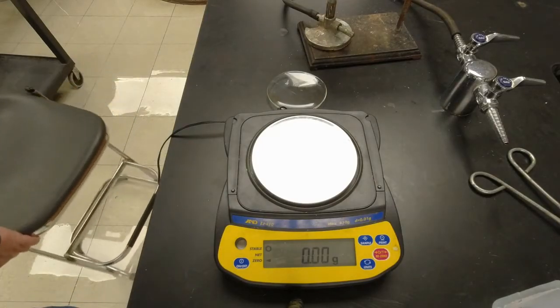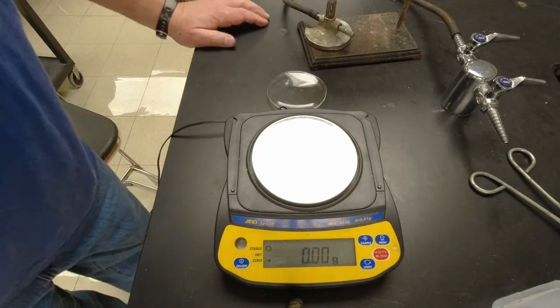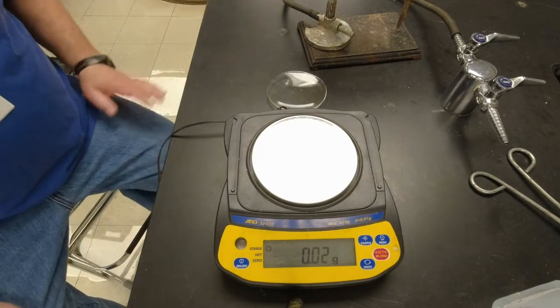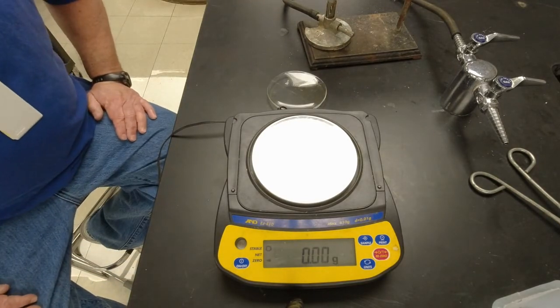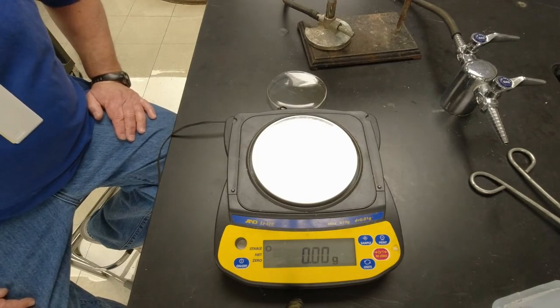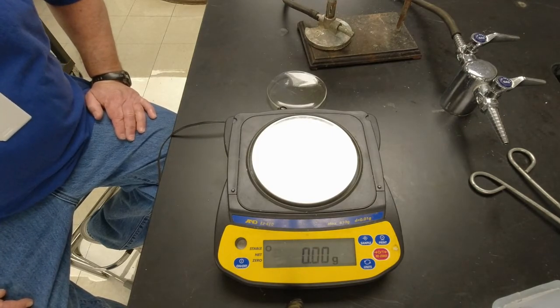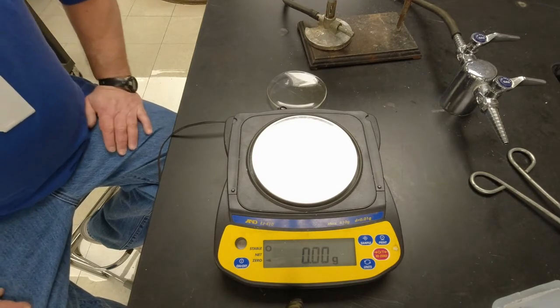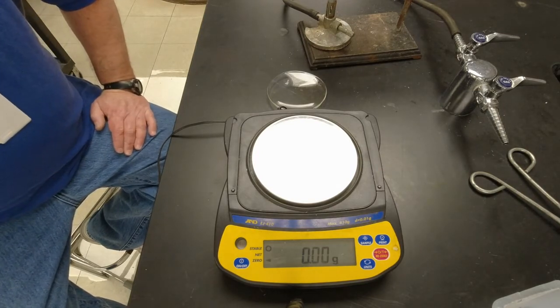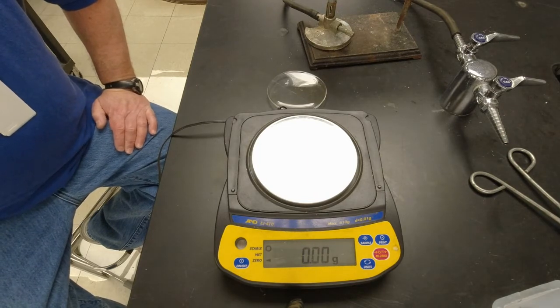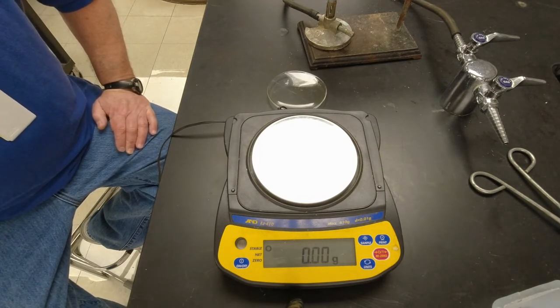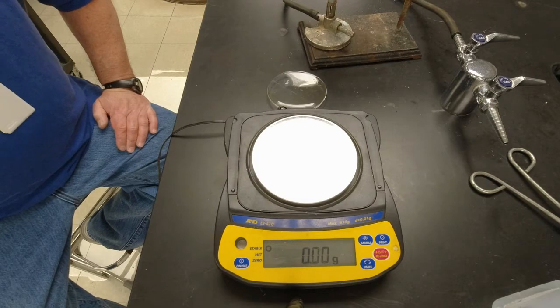Hi chemists. We're going to do another lab, and this lab has to do with—I'll bet some of you have done this before—how many of you guys have ever played with baking soda and vinegar before? You put little drips of vinegar on it and the baking soda boils like crazy. Well, that's basically what we're going to do today. But we're going to use a different acid. We're going to use hydrochloric acid, which is much stronger than acetic acid. That's what vinegar is—it's acetic acid. And we're going to make some very careful measurements with this.